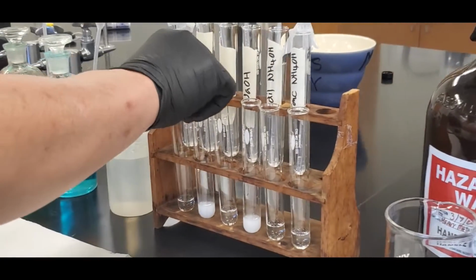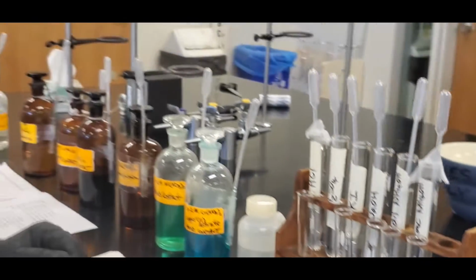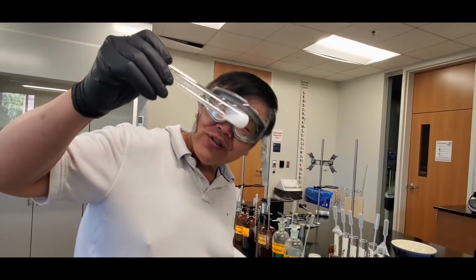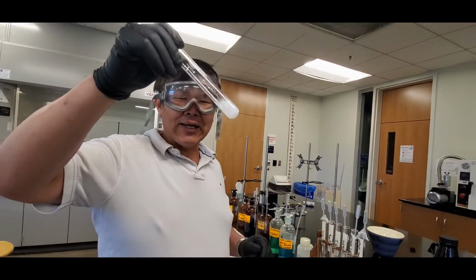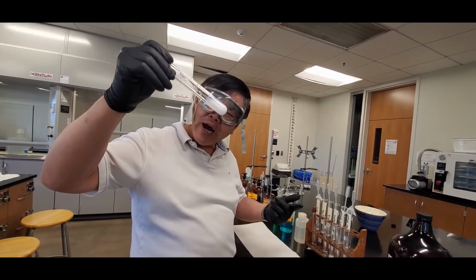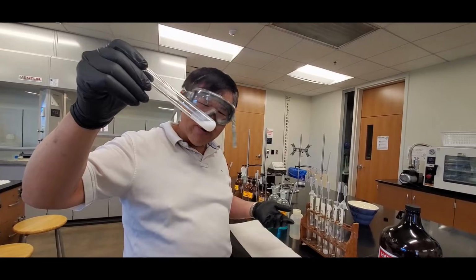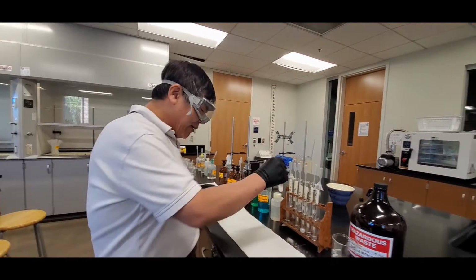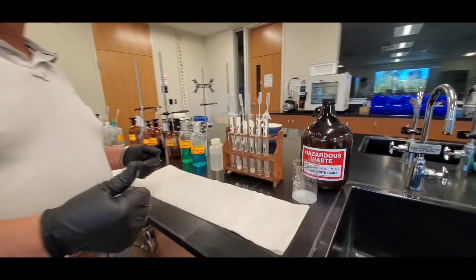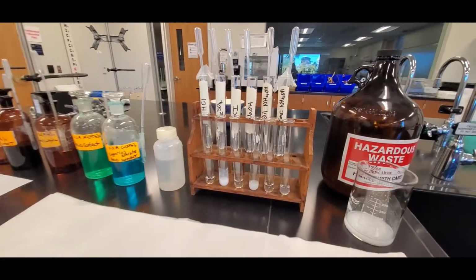Okay, now watch this. This one's pretty cool. This is the one with the sulfuric acid. It's a gel. The thing is that it's what they call slightly soluble, okay? So if it's a precipitate, it's insoluble. But if it's a gel, it's slightly soluble, all right? So that's the one I want you guys to see. Let's zoom in to see what it looks like, and later on I'll give you guys a picture of it.